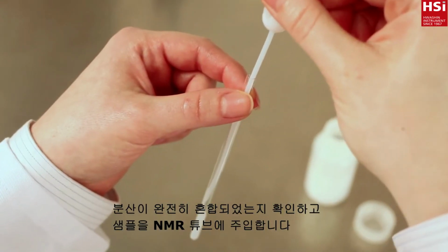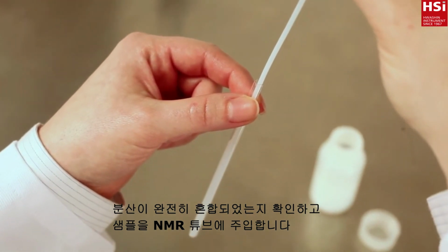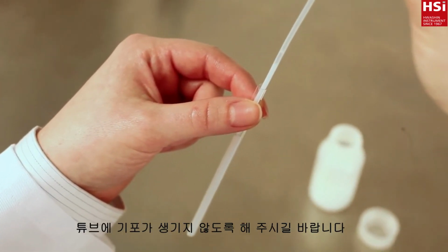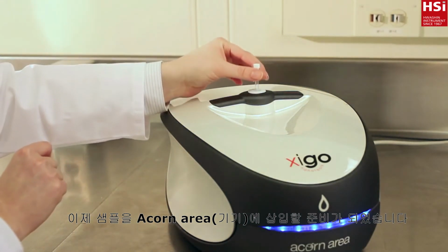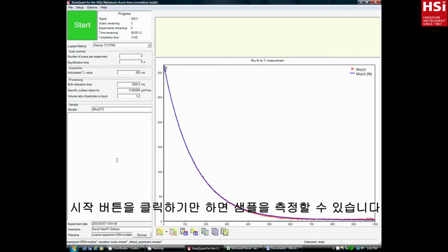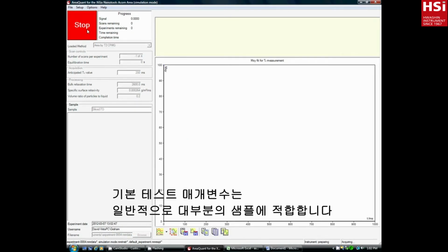Make sure your dispersion is fully mixed and load your sample into the NMR tube. Do your best to keep air bubbles out of the tube. You're now ready to insert your sample into the Acorn Area. To make a measurement of your sample, simply click Start. The default test parameters are usually adequate for most samples.